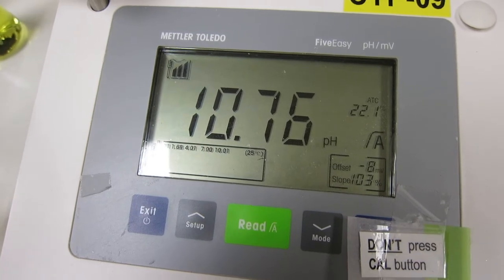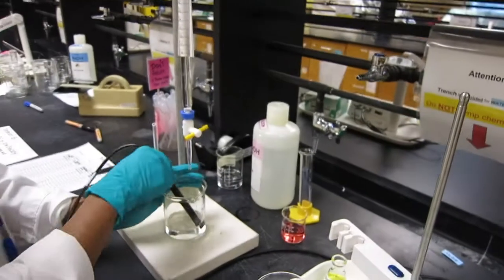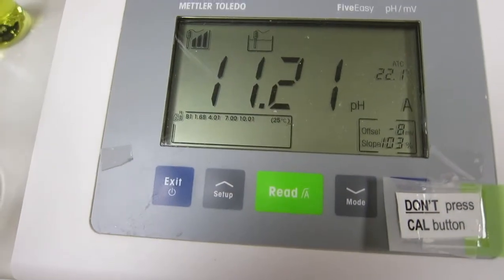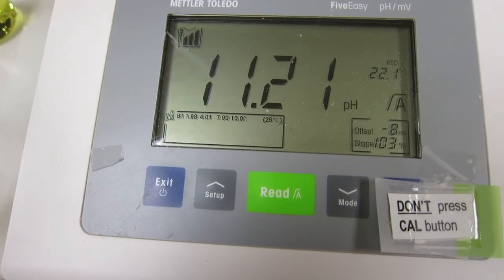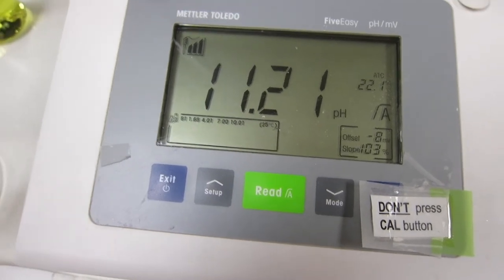The pH is 10.76. Now adding 25 mL total — one more mL. The pH is 11.21. One more mL, at 26 mL.